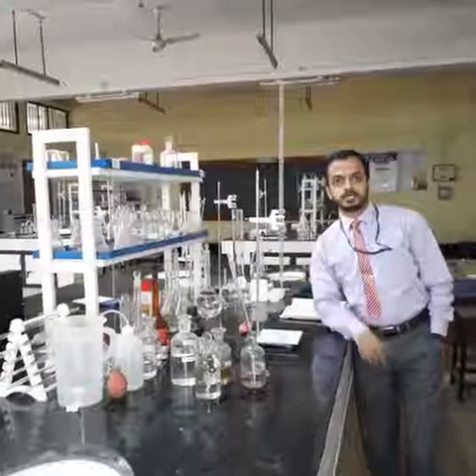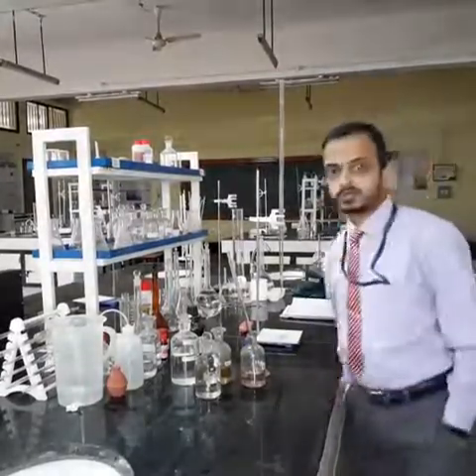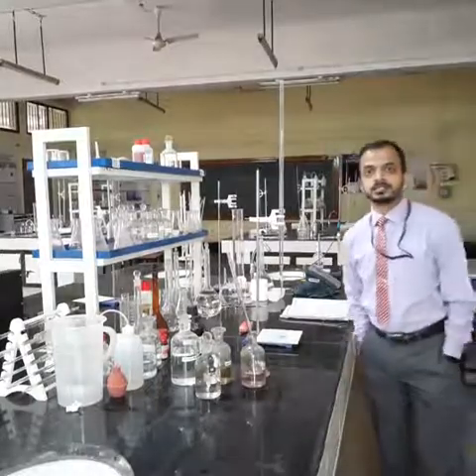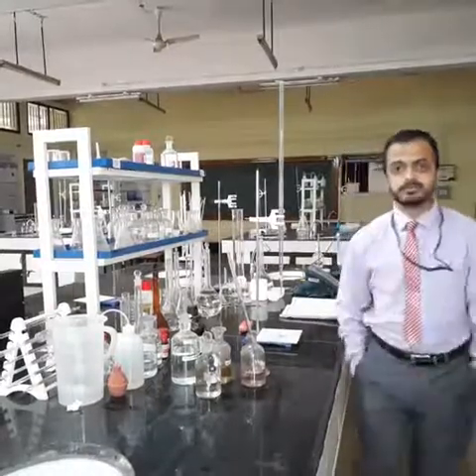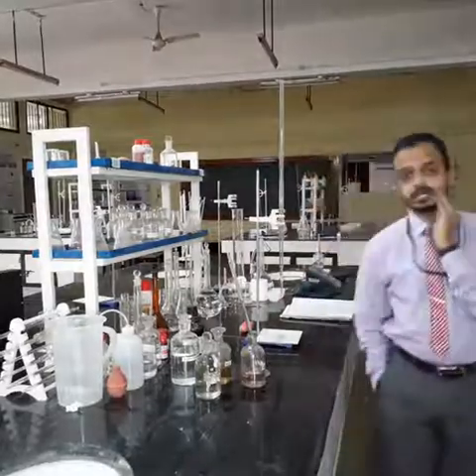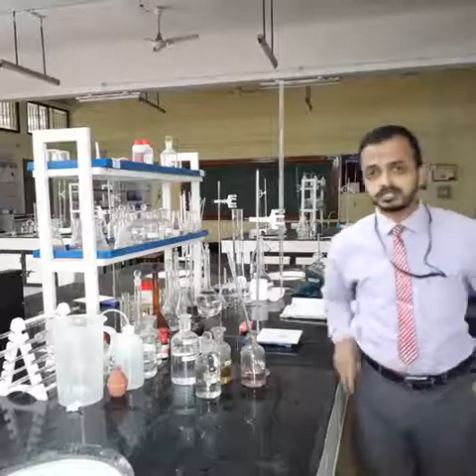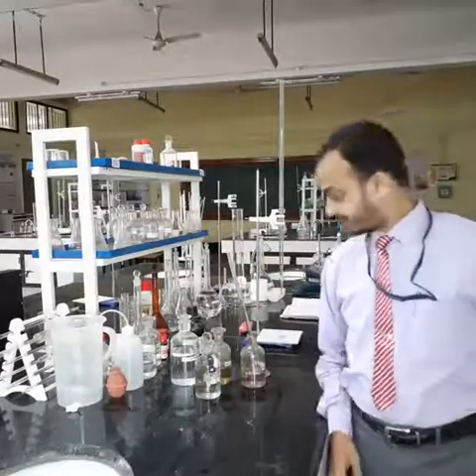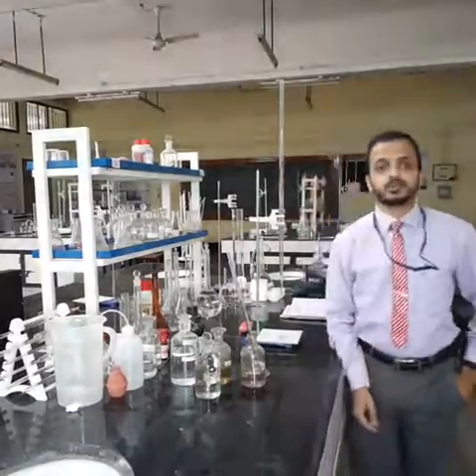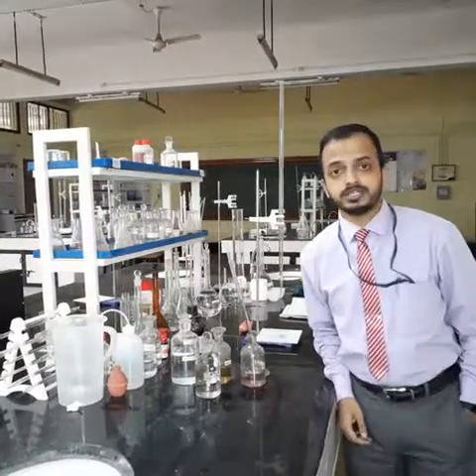Good afternoon, friends. Welcome to the session on determination of dissolved oxygen in the given sample. The sample may be either a water sample or a sewage sample. For convenience, I am going to take a water sample to determine the dissolved oxygen that is present in the water. To begin with the experiment, we shall first understand what is the meaning of DO and why it is necessary to be present in the water.